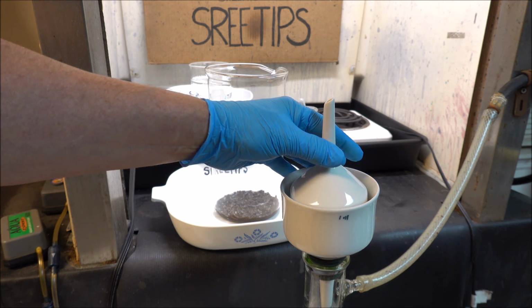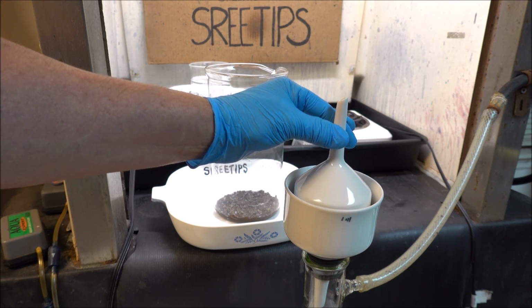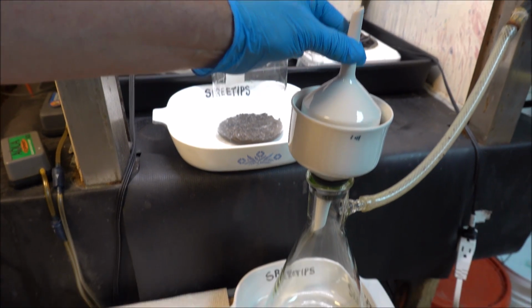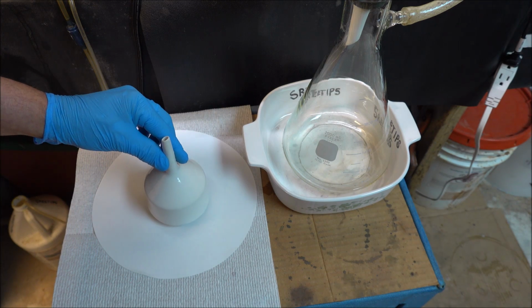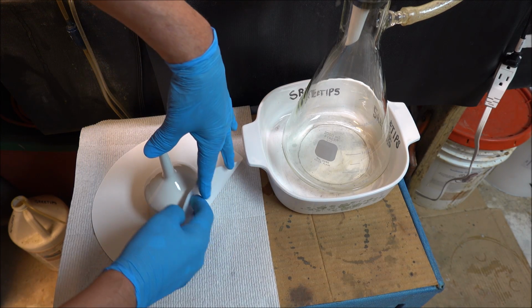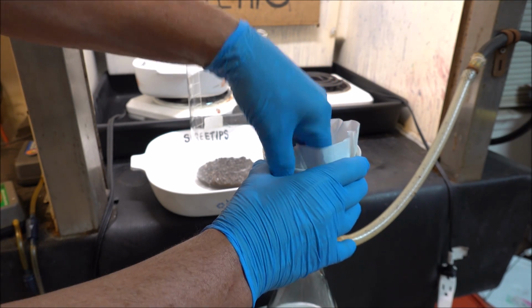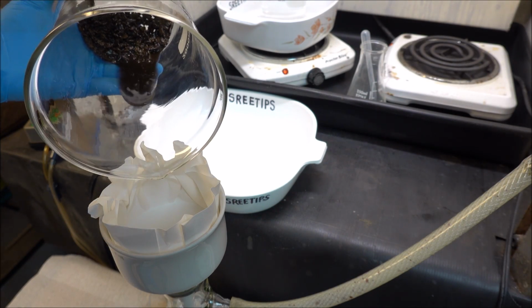And what I'm going to do is I've got a Buchner funnel here and another one that fits down into it perfectly. I've used this method in the past with good results, so I'm going to employ it here. I'm going to use this funnel as a pattern and make a fitted filter paper. Here we go. I'm going to transfer my gold into this filter now.